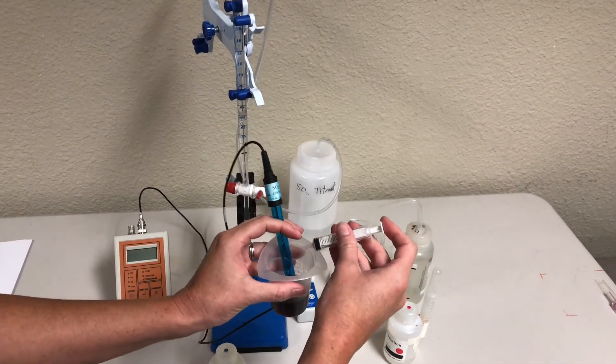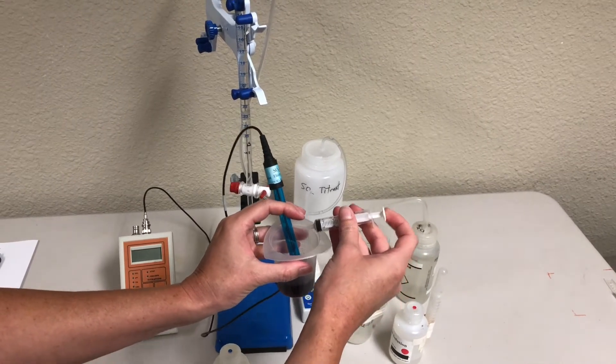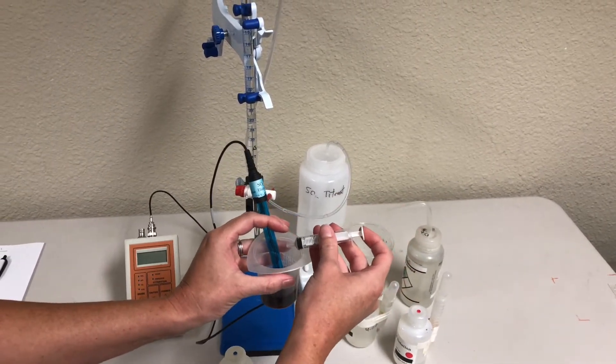Today we have access to the ProKit setup, so we'll be doing it a little bit differently, but this ProKit setup will make it much easier to run the test.